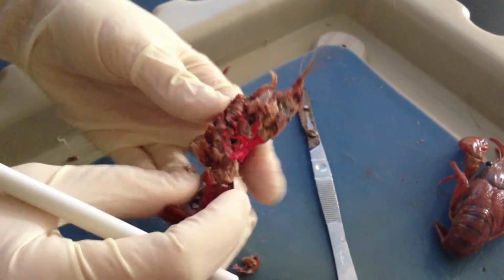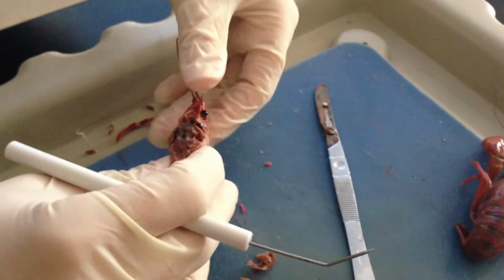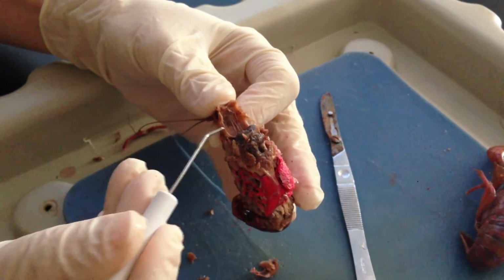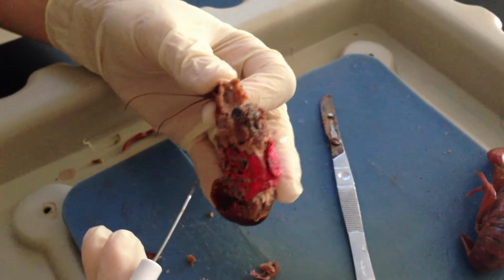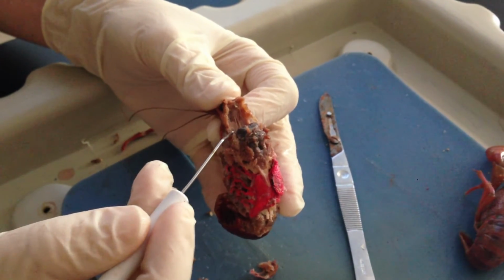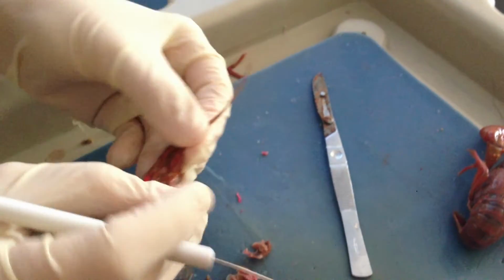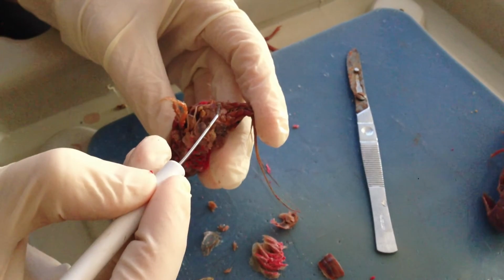Okay. Going back up to the most anterior end of this organism, I'm going to pull this down, all right, and you can see that when I pulled it down, I've exposed more of the stomach, but down below in this region are these two different glands, and they're the green glands. The green glands are used to regulate the amount of nitrogenous waste that's inside of this organism and regulate the salt. It actually releases out, if you flip it back over, into these two pores right here.